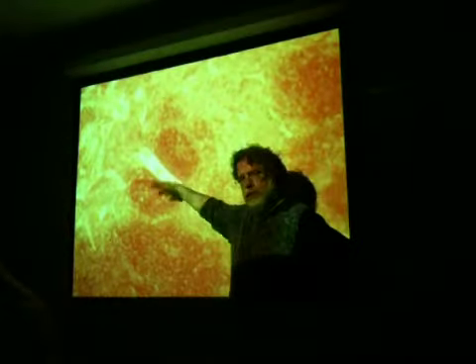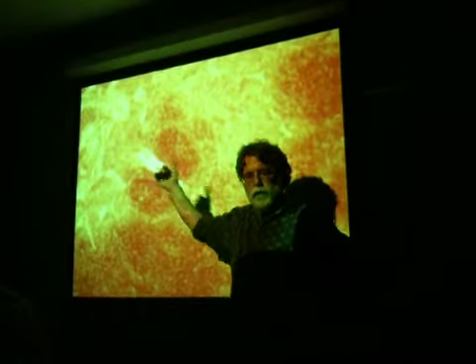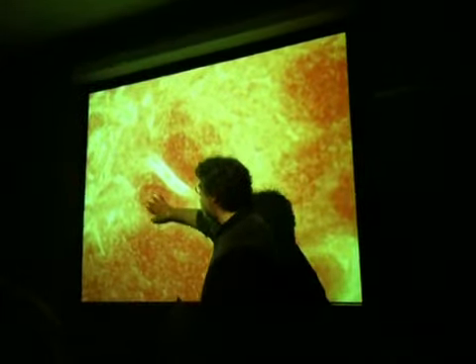Anything in the middle would be the medulla, right? These are just general areas. They're not even telling you what's in there. Where's the medulla? So the cortex is anything from the lymph nodules out to the boundary. And anything inside, let me go even deeper in, would be the medulla. Medulla is in the middle.